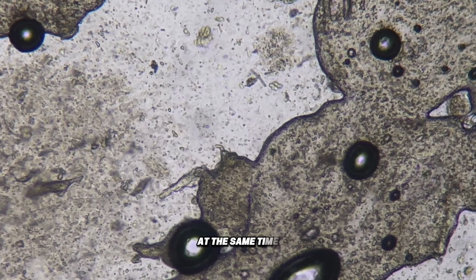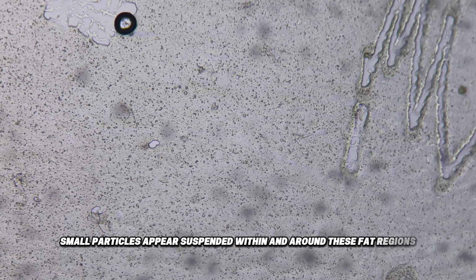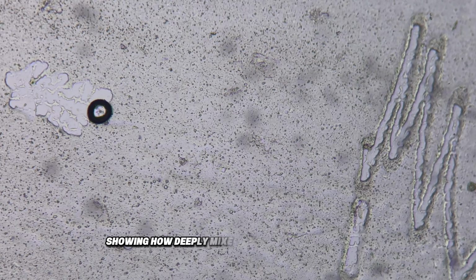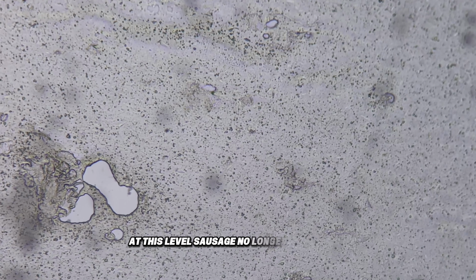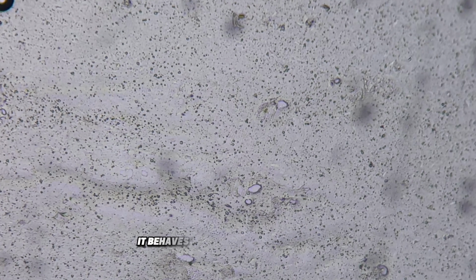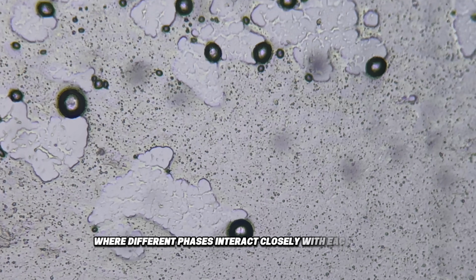At the same time, small particles appear suspended within and around these fat regions, showing how deeply mixed the structure actually is. At this level, sausage no longer looks solid. It behaves more like a complex emulsion where different phases interact closely with each other.